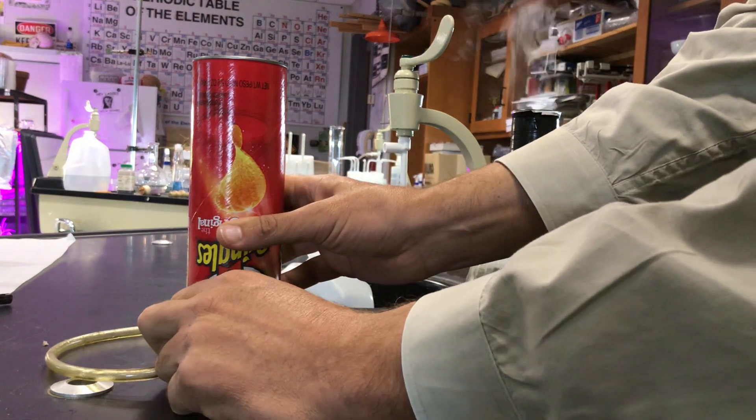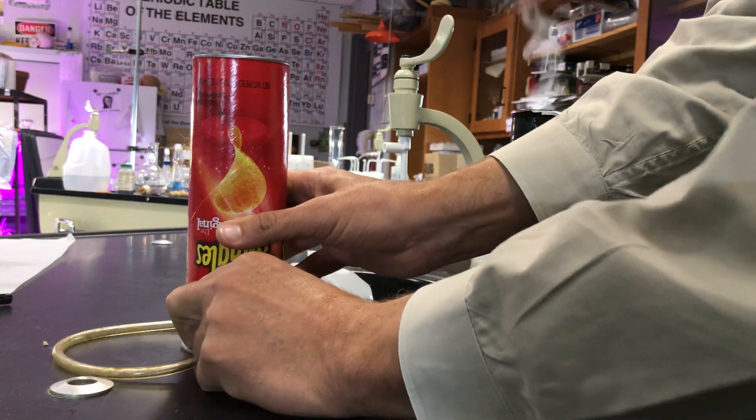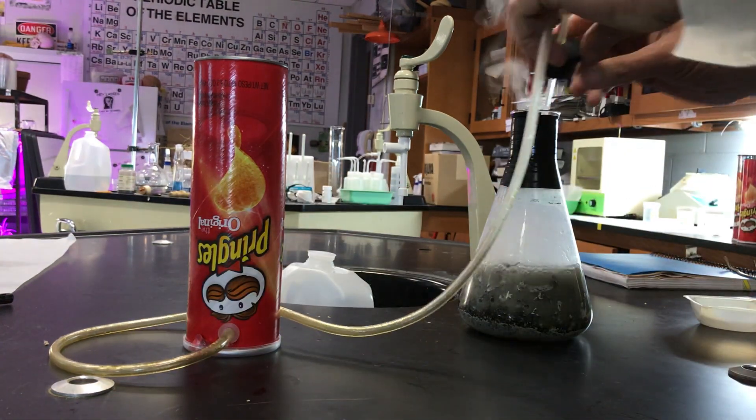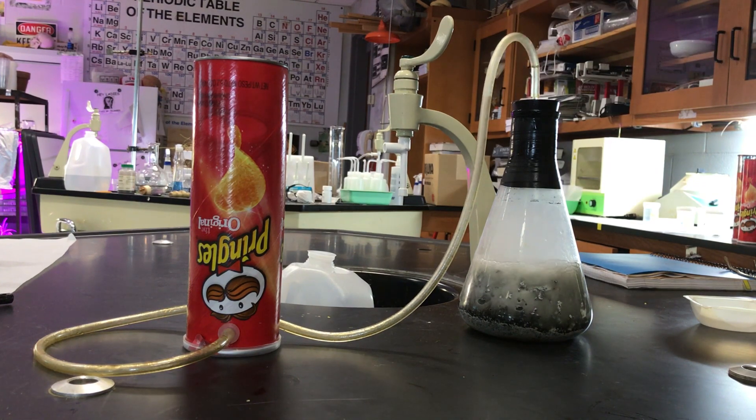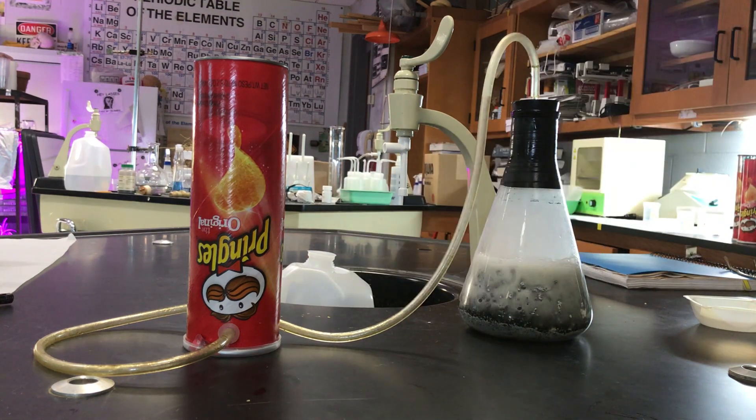I'm gonna put this in here. I'm just pumping this up with some hydrogen gas. I want to flood this can with hydrogen, make sure the entire can is filled up with hydrogen.